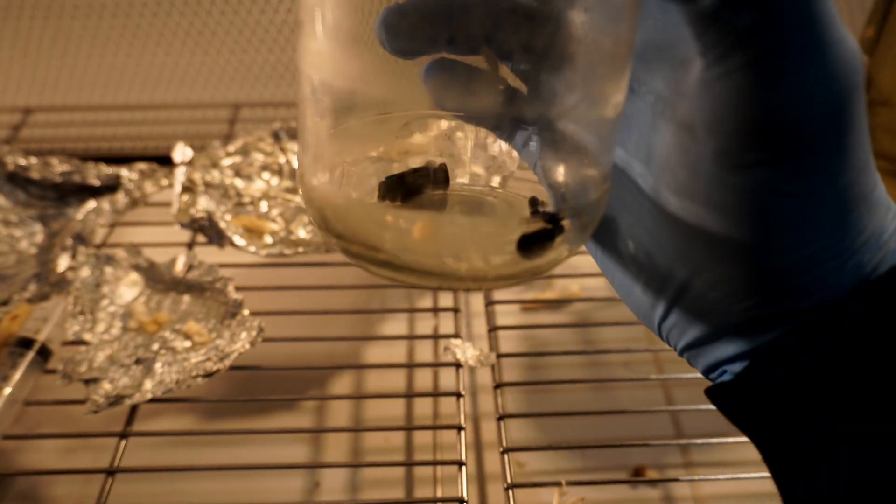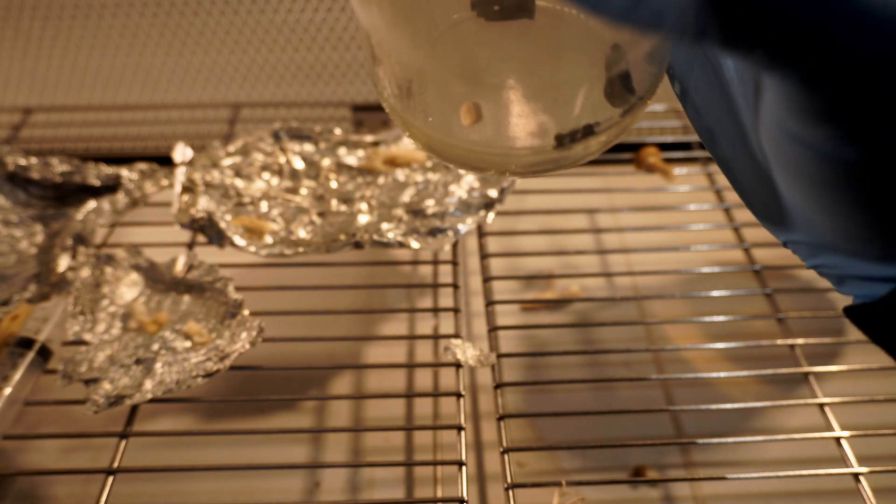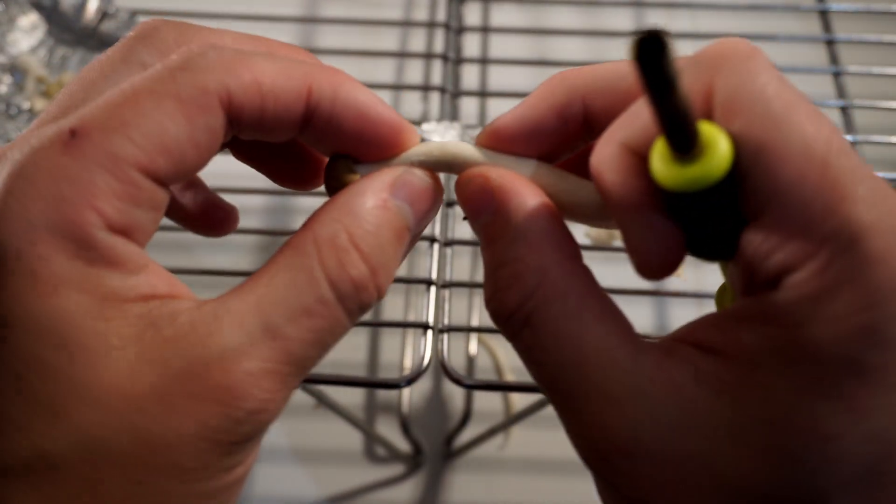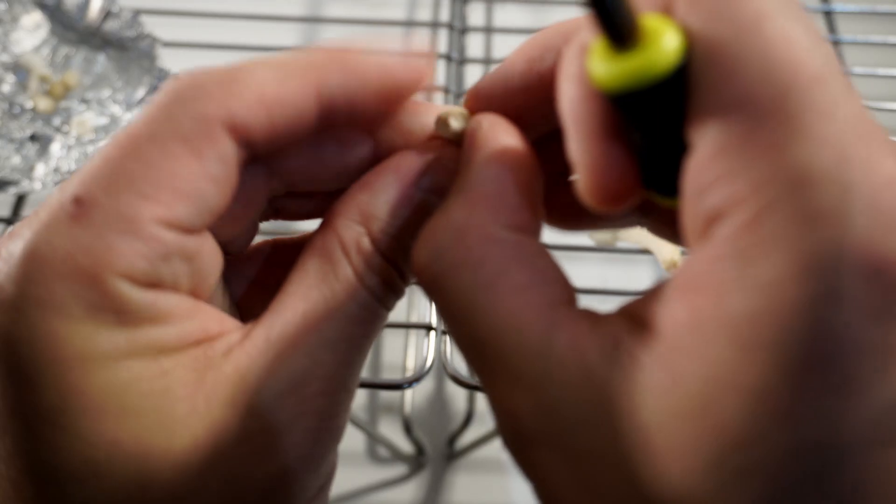I filmed this and realized that I was out of focus so I went back and then filmed again a second time so you can have a look at it again here.